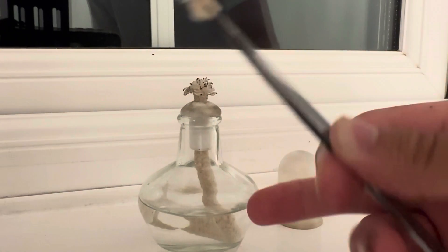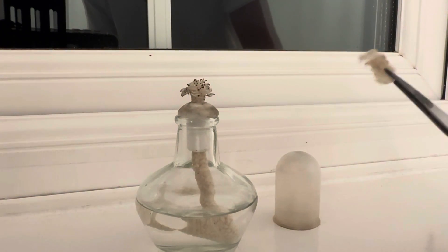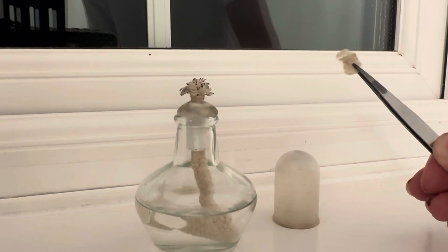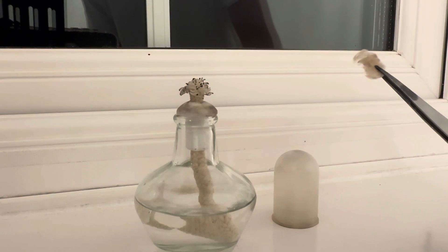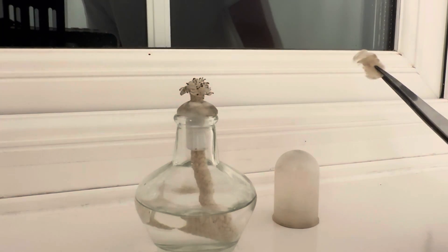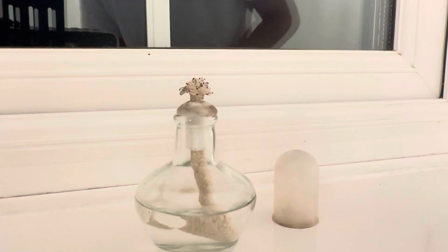An alcohol lamp, which is soaked with methylated spirits, which is pure methanol here, will not spontaneously ignite with air because, simply put, there is not enough activation energy to ignite the alcohol flame.